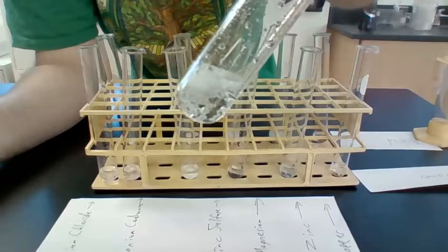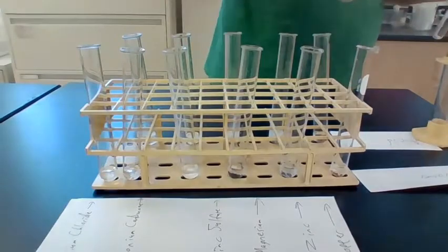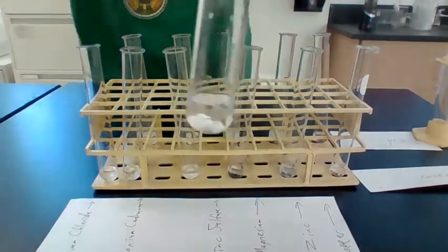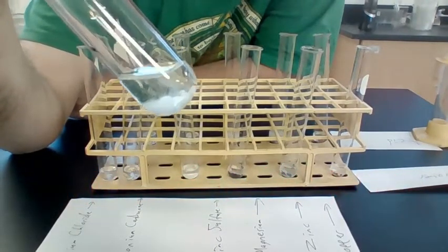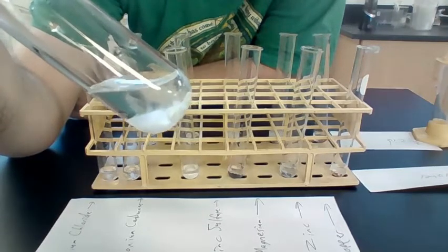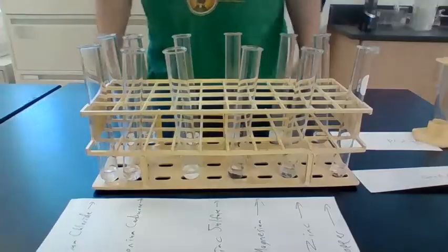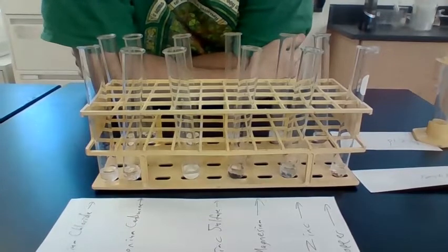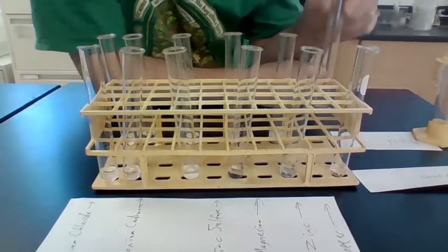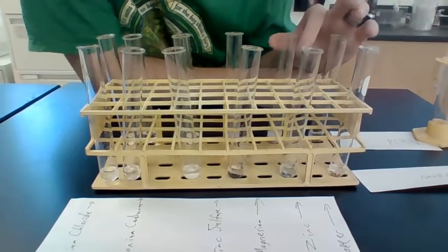Again, this bubbled pretty ferociously, so we definitely have a chemical reaction there. It seems to be a weak reaction with the calcium chloride. So under observations, you're going to say what you can observe from these things. It seems like the copper with acid, it got a little shinier, but it's basically just got wet. The same with the water.